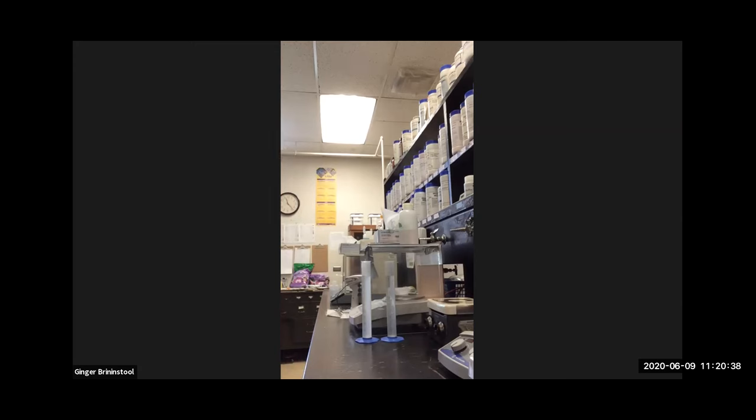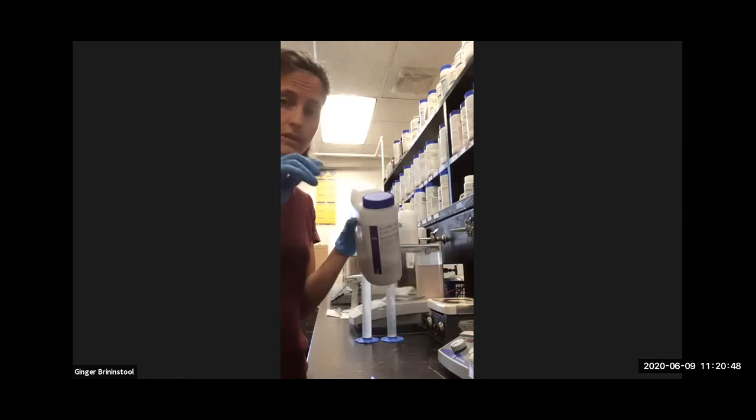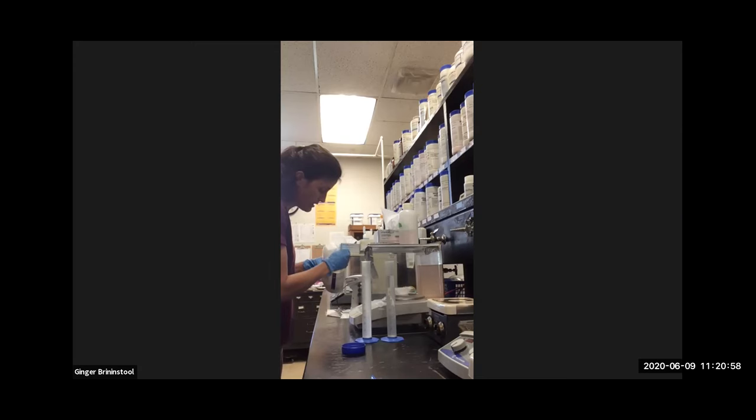All right, so over to my scale I go. I need a few things to measure. I need a spatula that's clean or has only been used for nutrient agar. No dirty spatulas. And it's still tared, so that's good. And I reach in carefully and weigh out 2.3 grams. I don't weigh out huge chunks at a time. I go back in as often as I need in order to reach 2.3. Oh, I'm so very close.